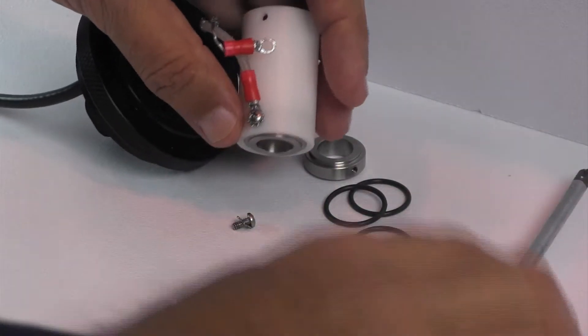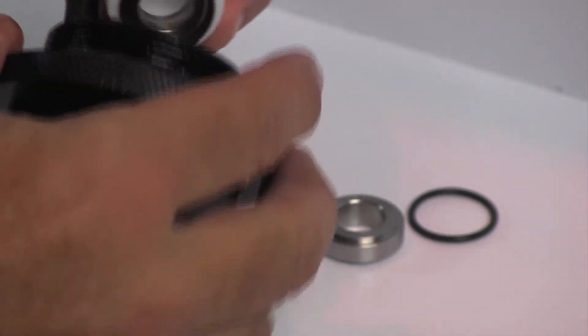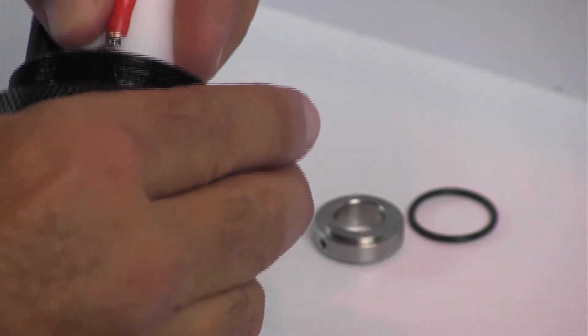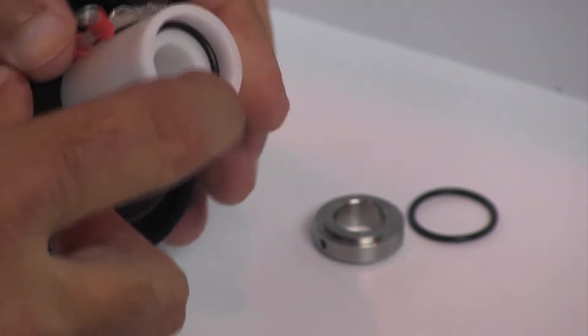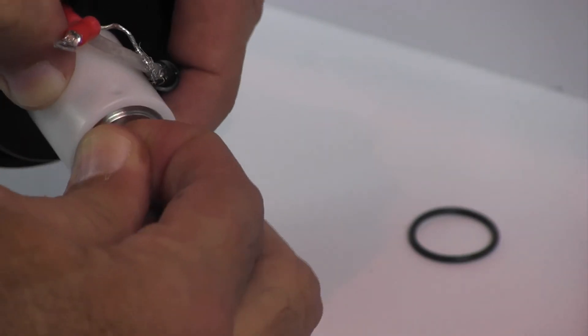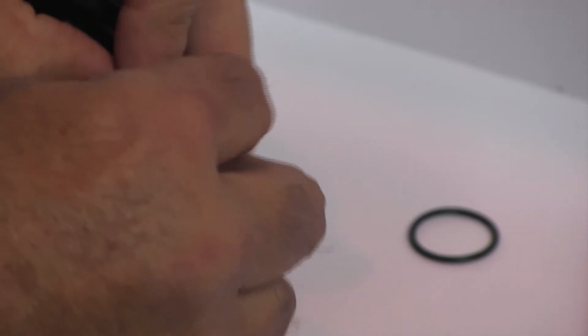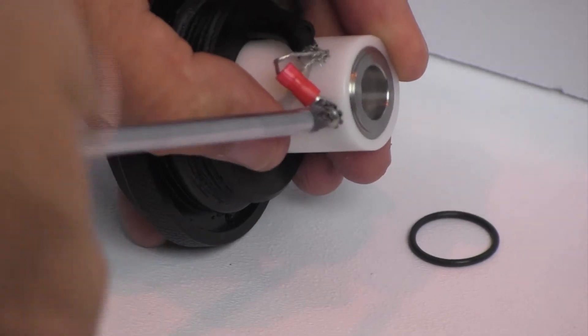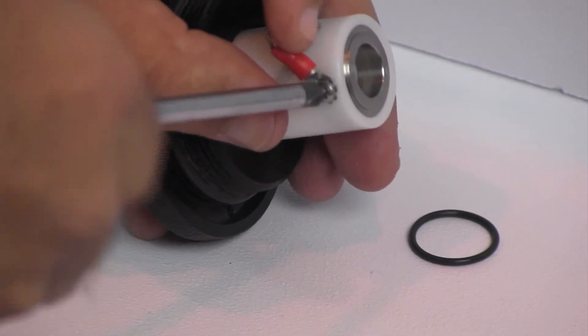Place an O-ring on the outside of the electrode and slide the sleeve into the sensor block bottom ring. Repeat the process for the other end of the sleeve and connect the bare wire to the second electrode.